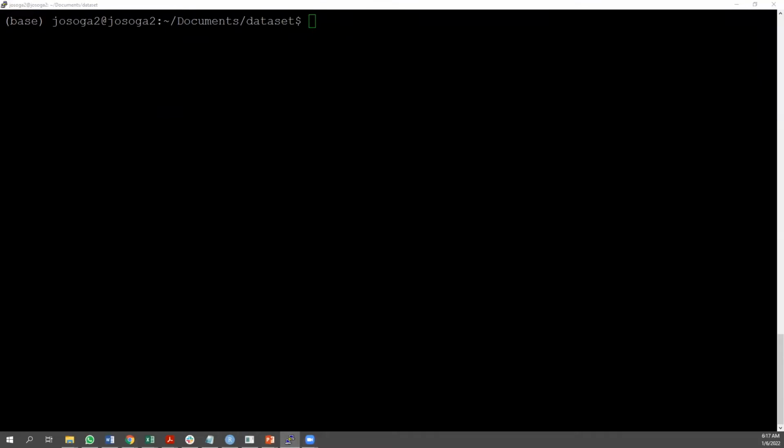Okay, so the first thing I do is to switch to the desired working directory here. And to list the files in my working directory, I say ls. To list the files in where exactly I kept the raw reads, that is the raw sequencing file, I kept them here, and you can actually see them.